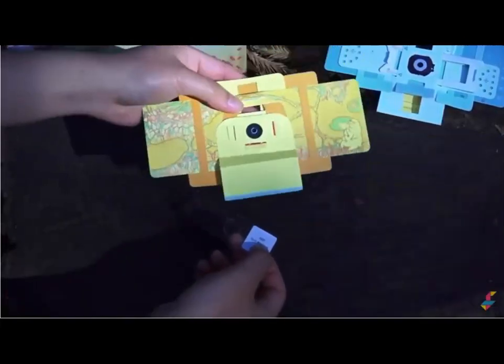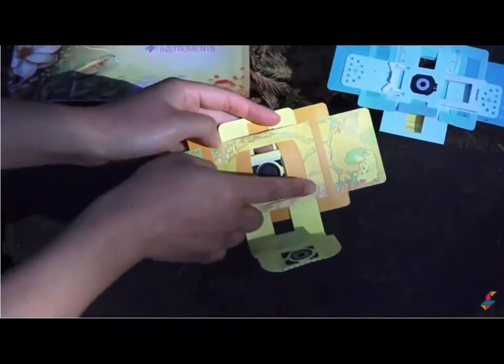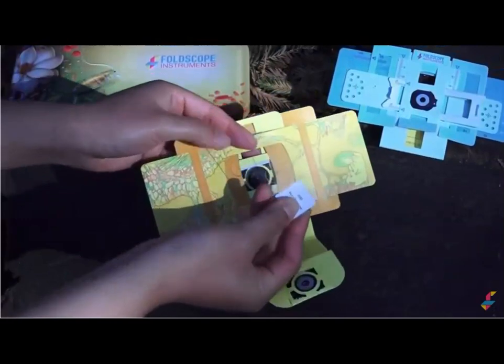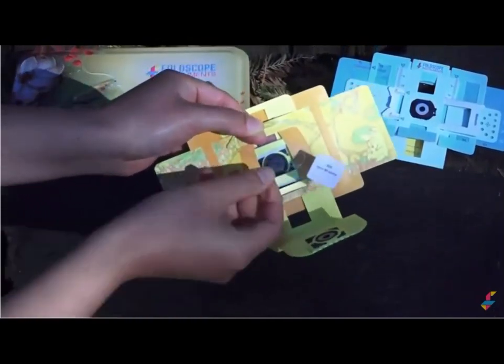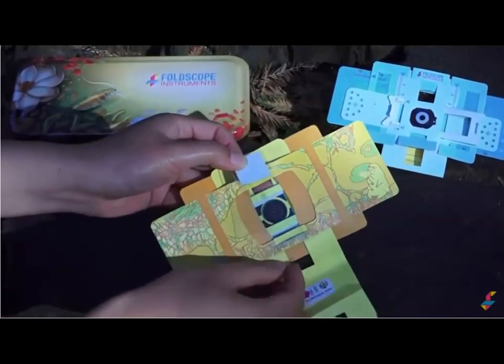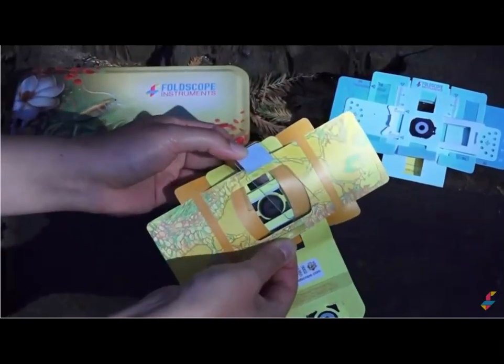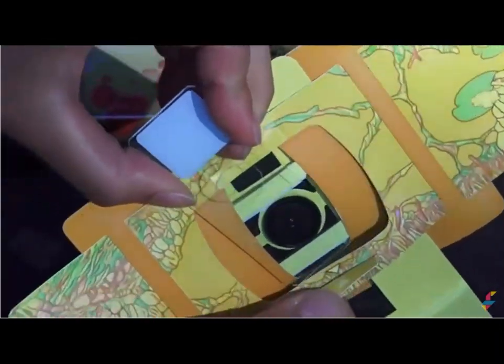I'm going to flip it over to the yellow side and then open the back tab like this. And you'll see full access to the sample stage where you're going to insert your specimen. Your specimen has a cover slip. Make sure that the cover slip side is down like this so that your sample is very close to the lens. I'm going to open the tab so that you see the arrows, and the arrows point to where you're inserting the slide.